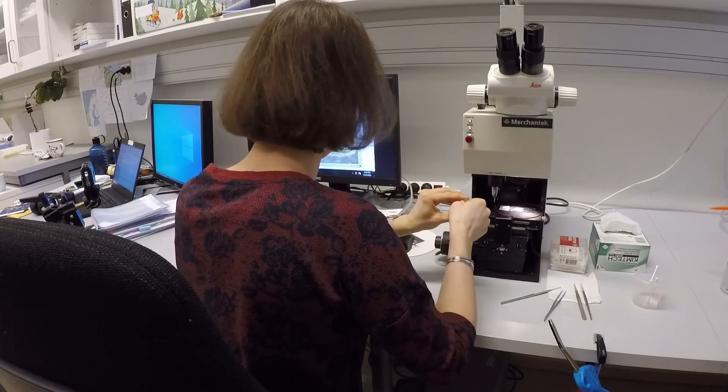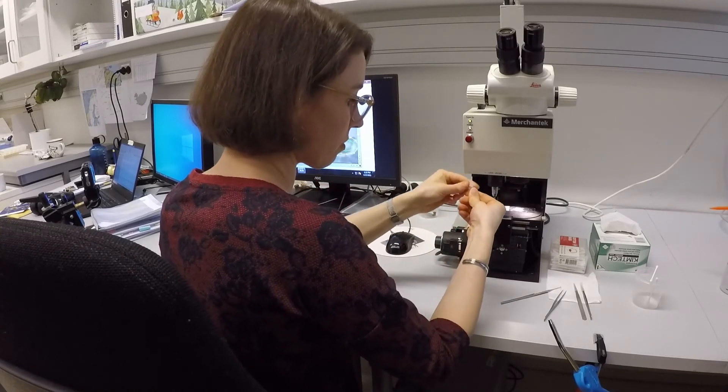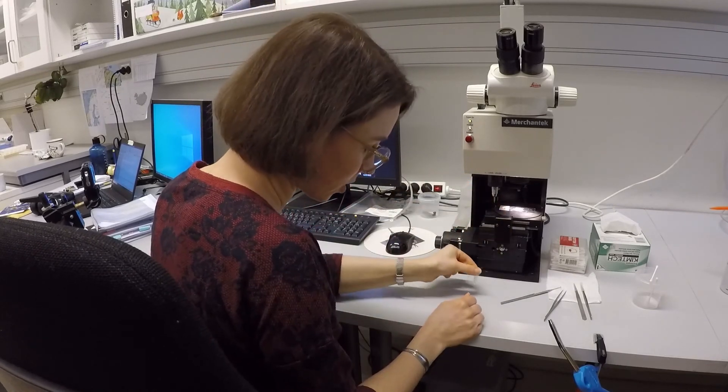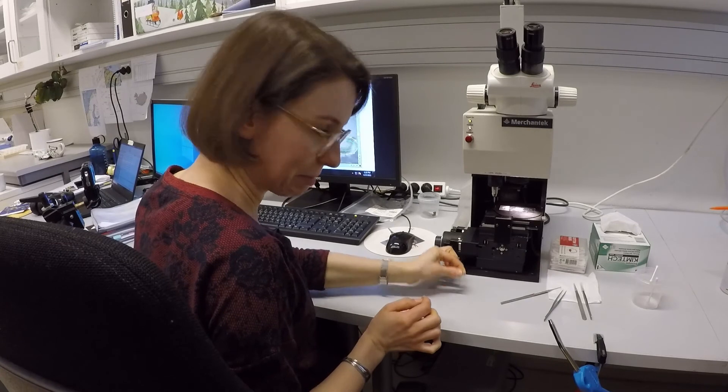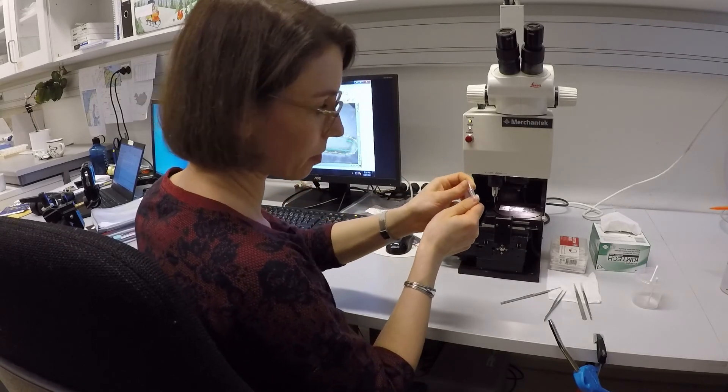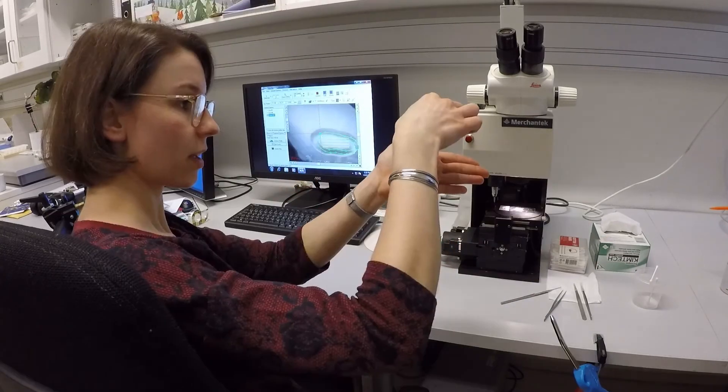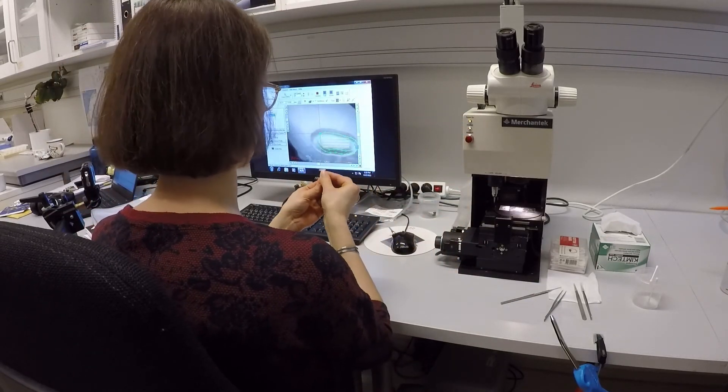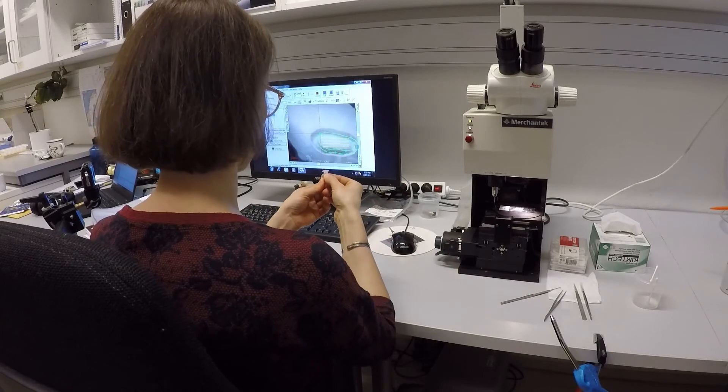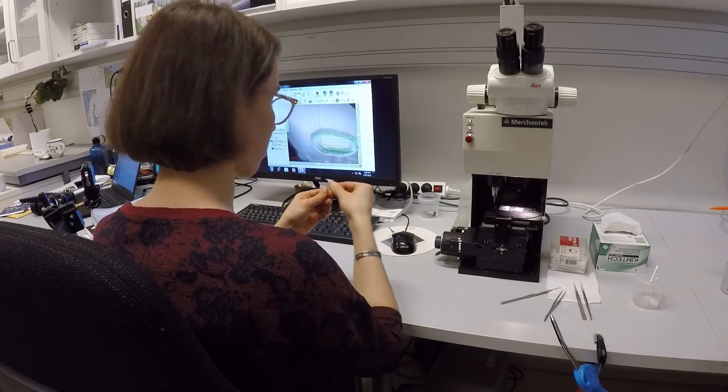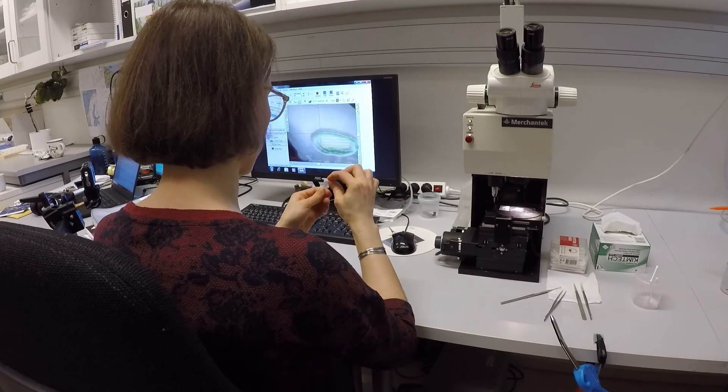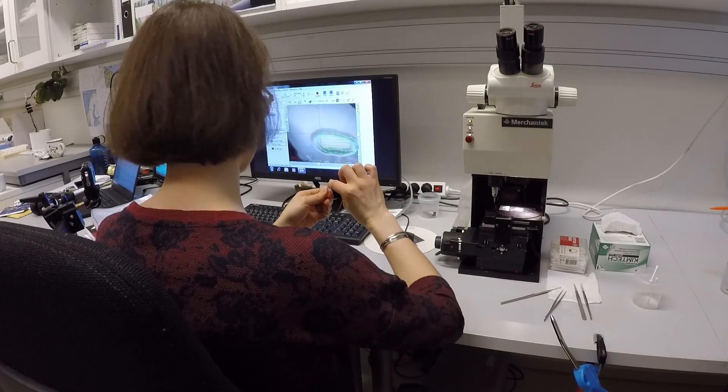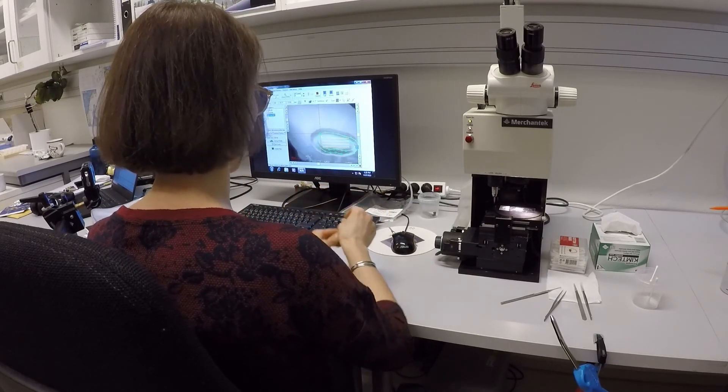So that looks good. Then I close the vial. So you can see all the sample material. So of course, do label the sample vials. So just with a permanent marker, for example, do write either on the ledge or on the side which sample it is.